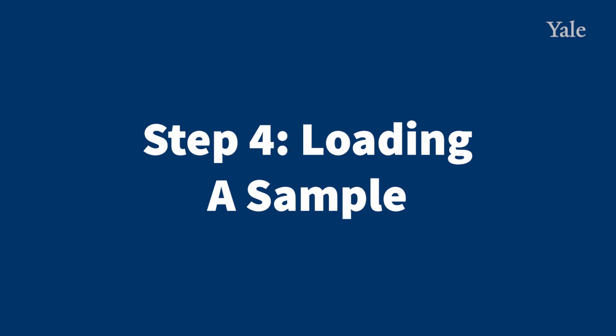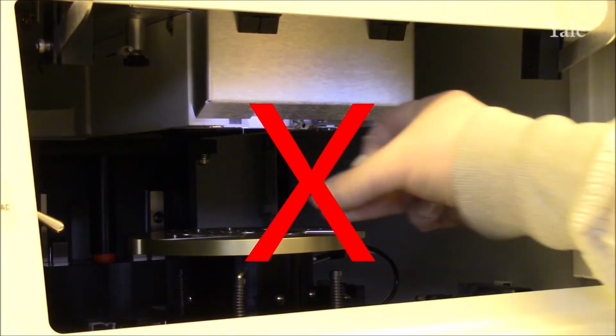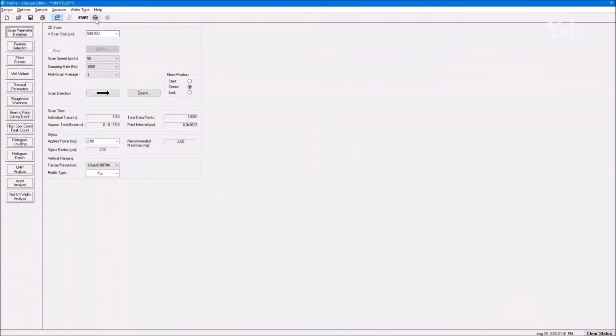Step 4, loading a sample. Once your recipe is configured as you would like it, go ahead and load your sample. Don't open the door and place the sample directly on the stage without unloading the stage. This can damage the stylus and be very expensive.